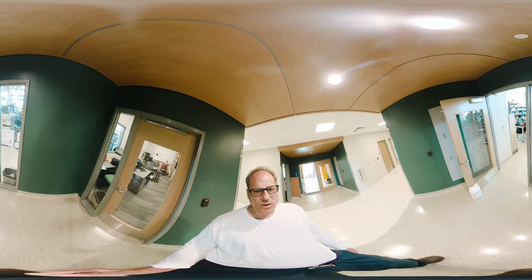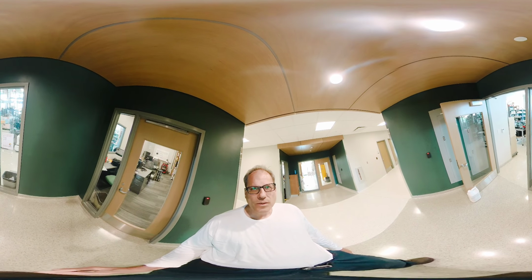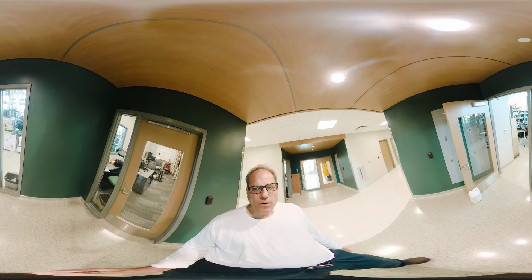My name is Uwe Burghaus. I'm a faculty member here in the chemistry department. Just moved into a new building, Sugihara Hall. I'm one of the 4 physical chemists we have. You can see the door sign here, so I'm specialized on surface science. It's a sub-area of physical chemistry. So we're looking at properties of surfaces, chemical processes on surfaces.